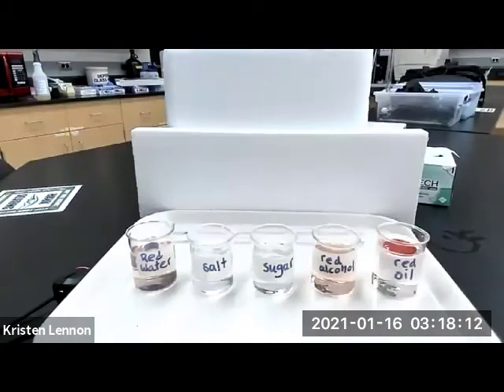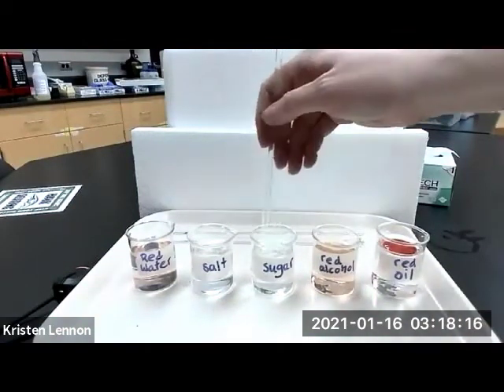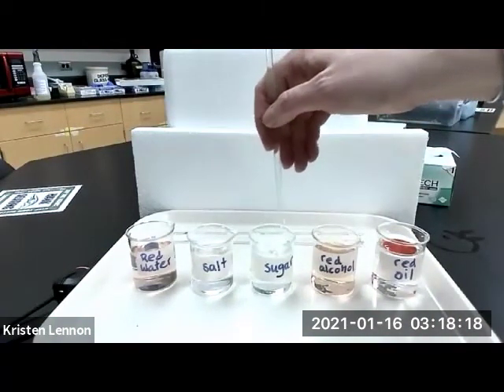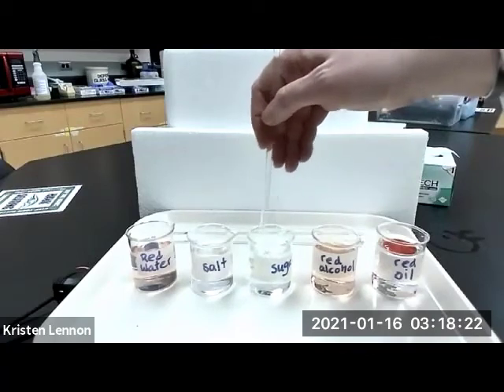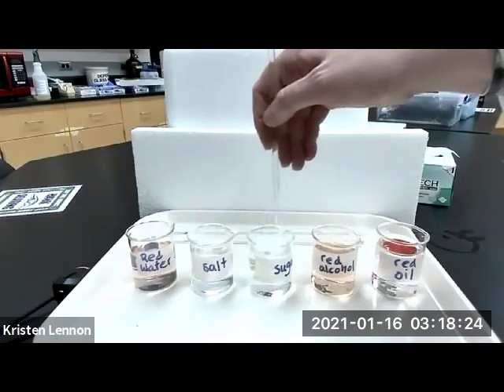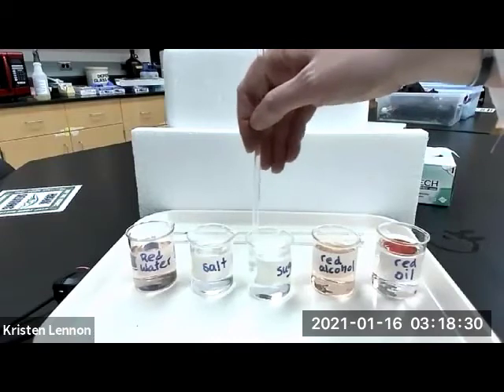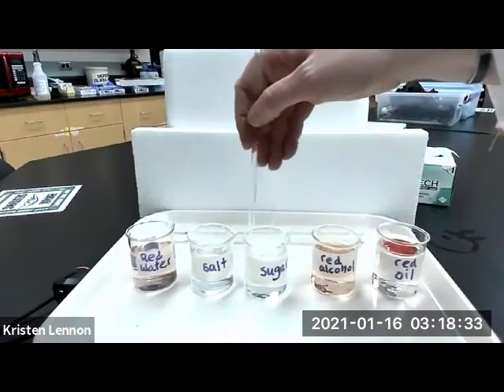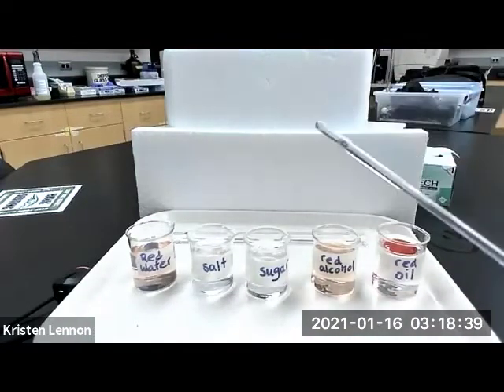Now the sugar, stir rod labeled C. Doing the same thing here. We have the solute, which is the sugar, mixed with the solvent, it's the water. Okay. Now we have the red ethanol or red alcohol.